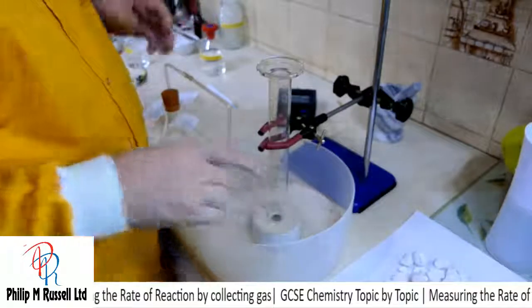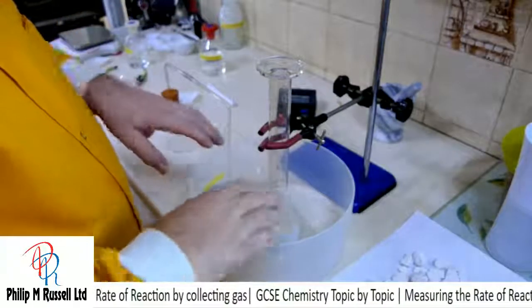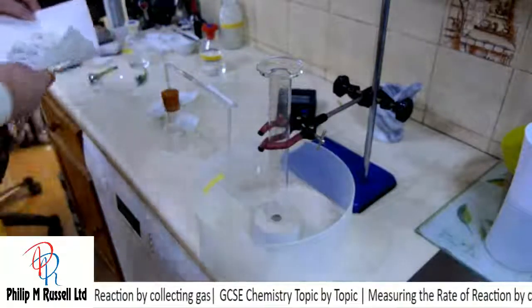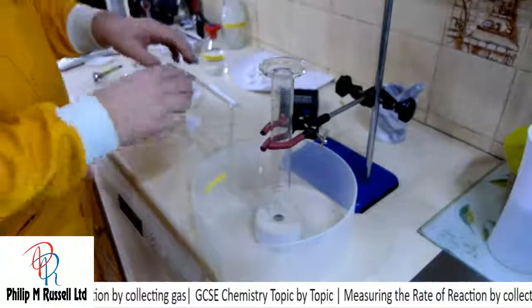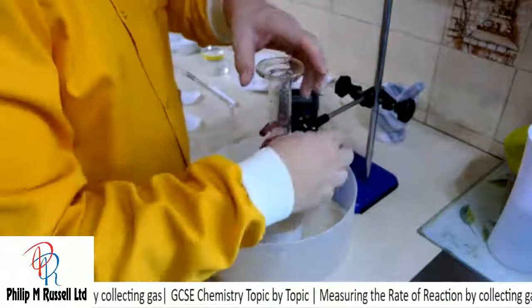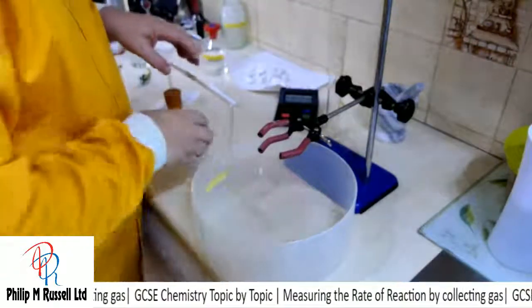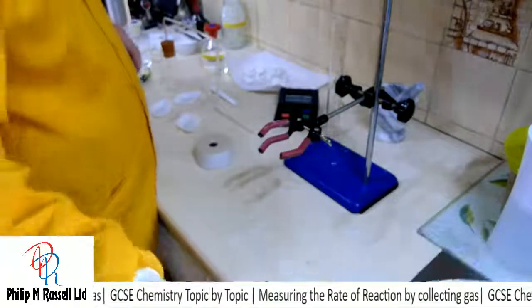The only difference is we're going to want to fill this all with water, so that when we start to do this experiment we're going to collect over water, and it's not going to reach, so I'm just going to move everything. Don't want it set up quite ready just yet because we have a little problem, and you've got a problem that I need you to solve for me. So there's that, and what we're going to do is fill this with some water.